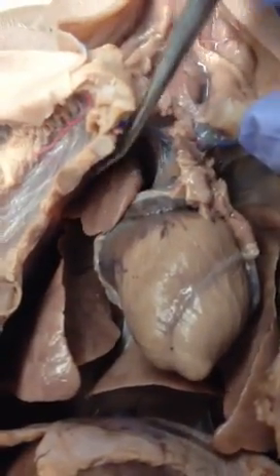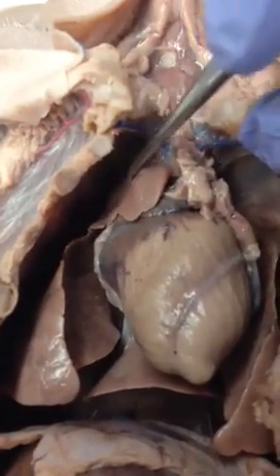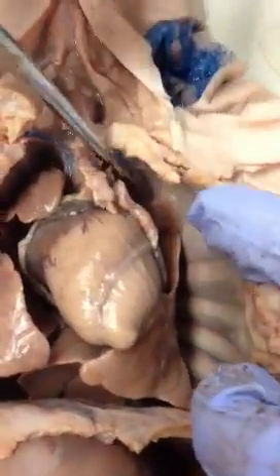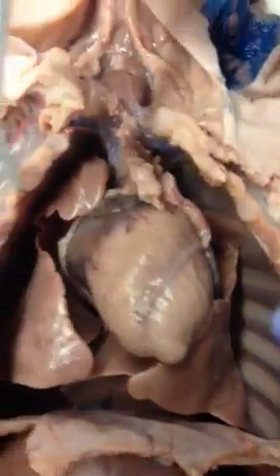Moving down, we have the cranial lobe of the right lung, the medial lobe of the right lung, and the caudal lobe of the right lung. This is the accessory lobe of the right lung. This is the caudal lobe of the left lung, and up here — it's really small — this is the cranial lobe of the left lung. There is no medial lobe of the left lung.